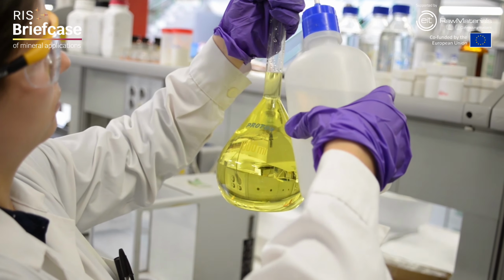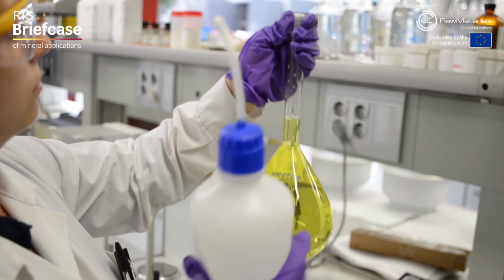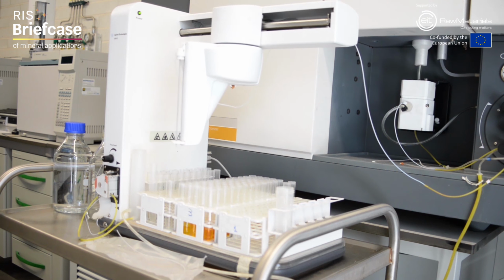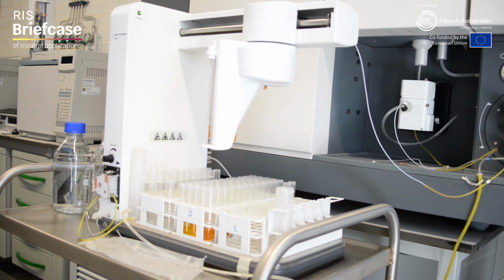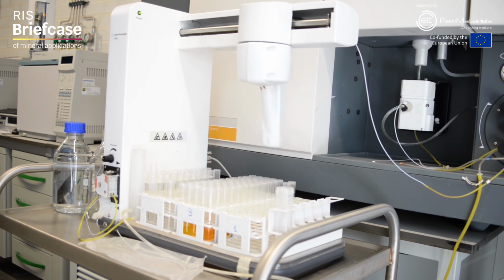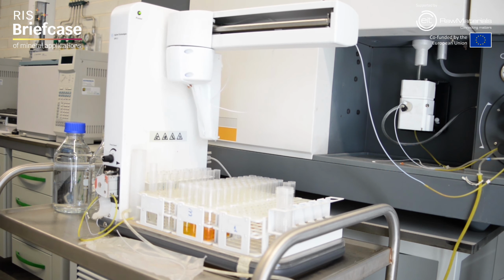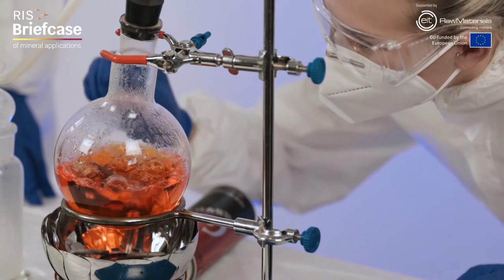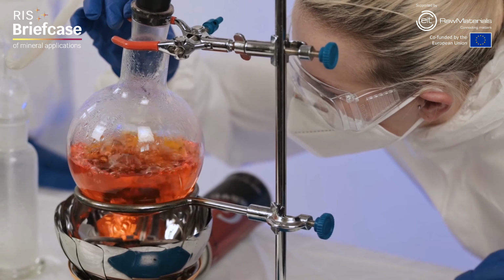metals are dissolved. This solution is filtered and prepared for analysis in equipment called ICP that returns the concentration values of metals in liquids, either in percent or in parts per million. For example, if we analyze a copper ore sample with this equipment, we will obtain values for the percentage of copper content. And so far, our Express Lab class.